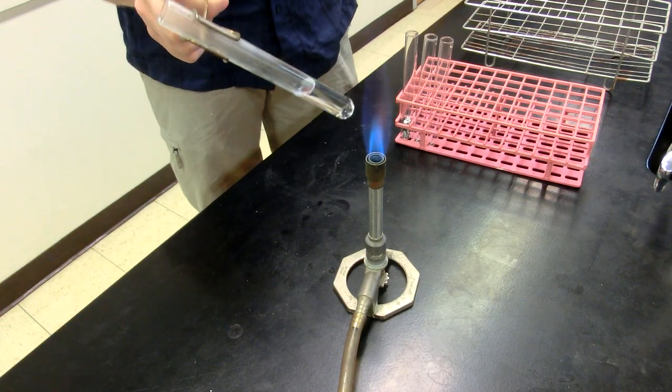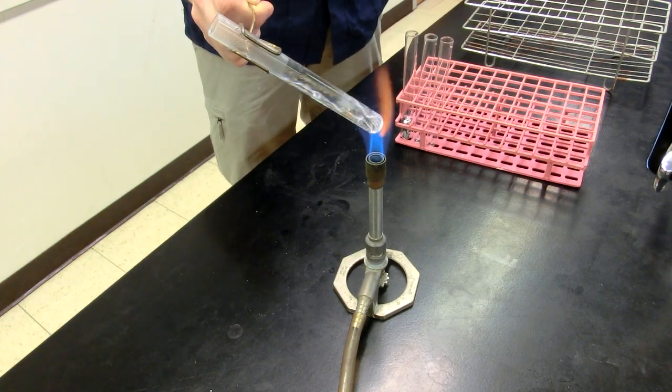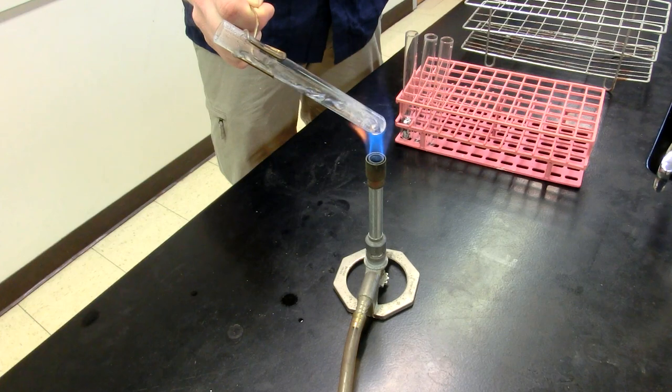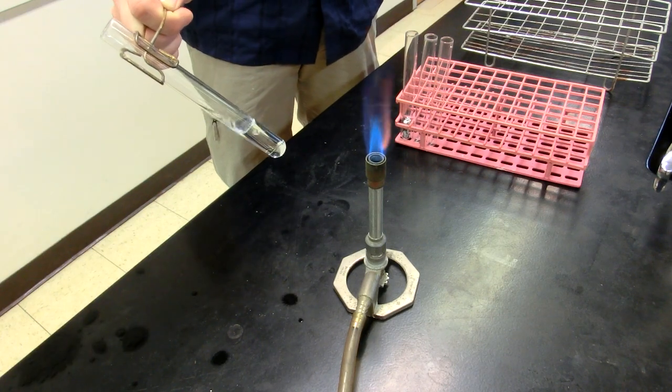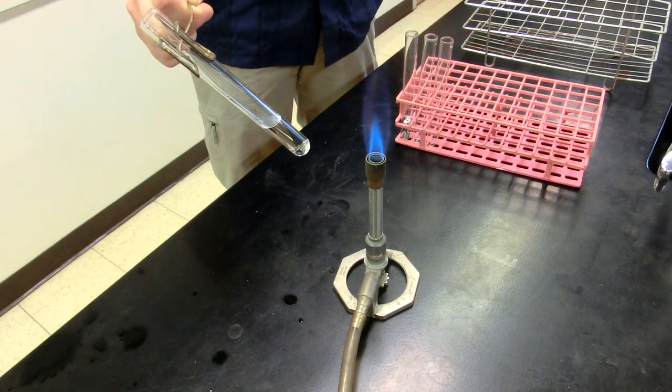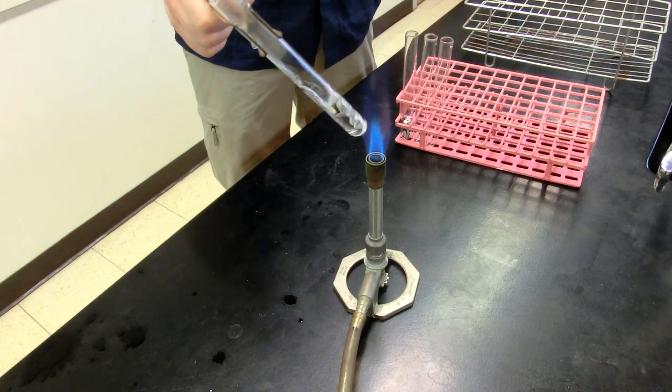All right, so let's go ahead and do some stupid things. Stupid thing: holding it into one position and you'll notice it's going to start to shoot out of the test tube and splatter at people. Bad day for whoever gets hit by that.